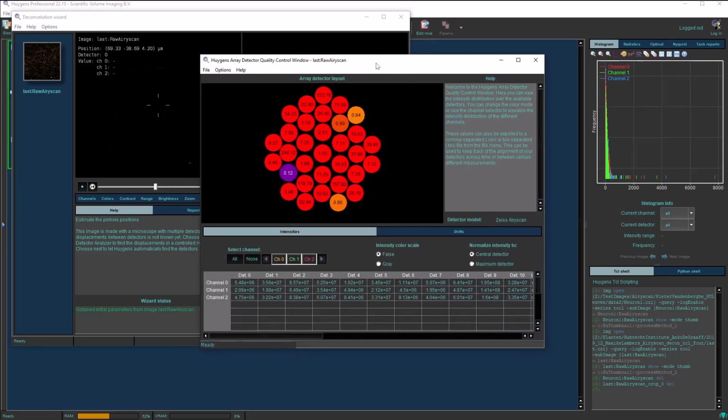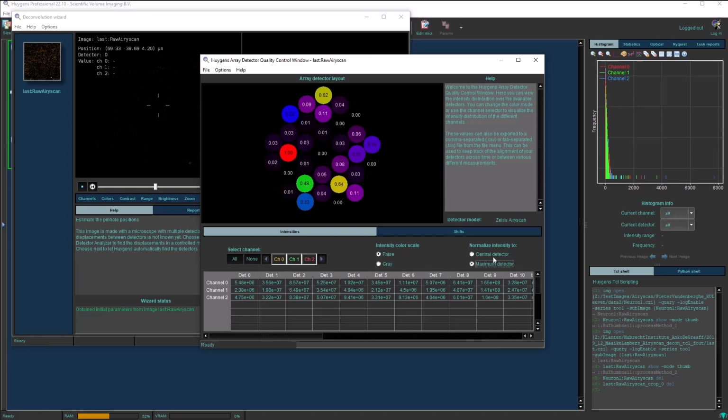And here we can really see that the intensities in all of the detectors are not really as we expect them to be. So the central detector is not the detector with the highest intensity. If we click on Normalize the intensity to the maximum detector, we see that this detector on the left has the most intensity with respect to all of them. And we can see in this table here on the bottom that the data does not match up with our expectations. And we can say maybe something went wrong when aligning the microscope, the lasers with the detector array.